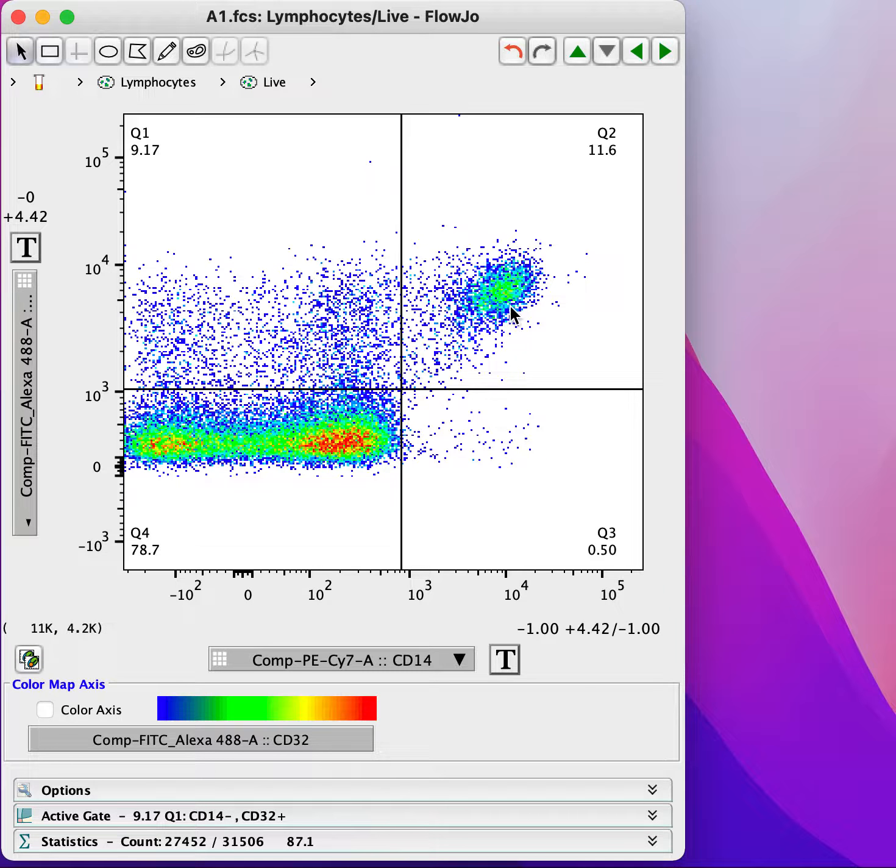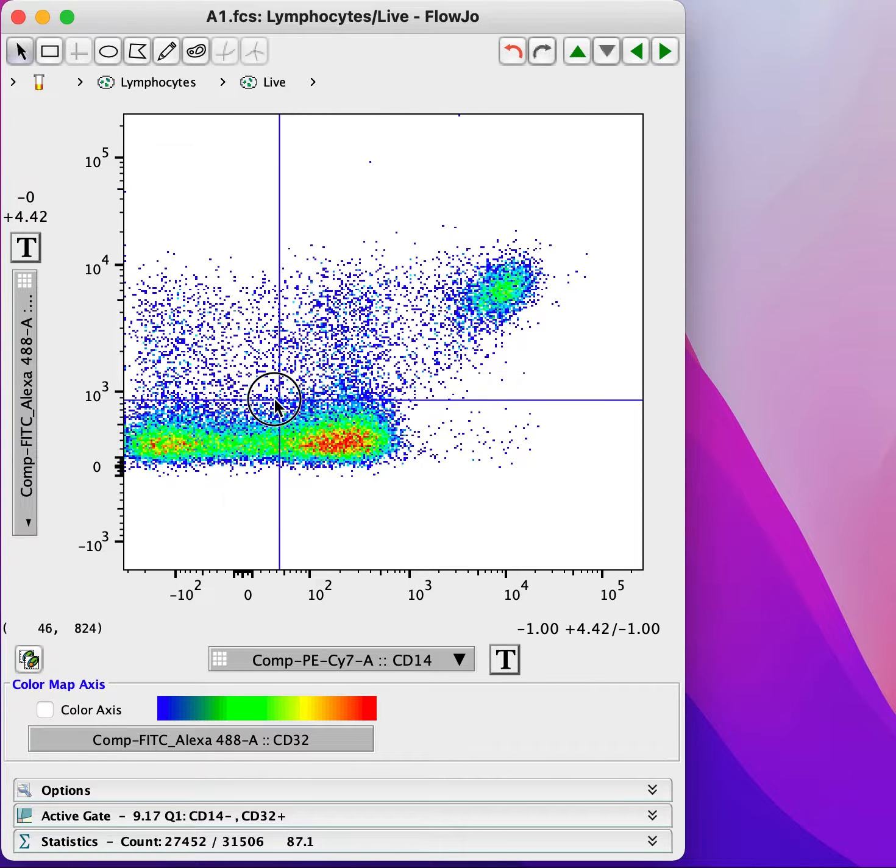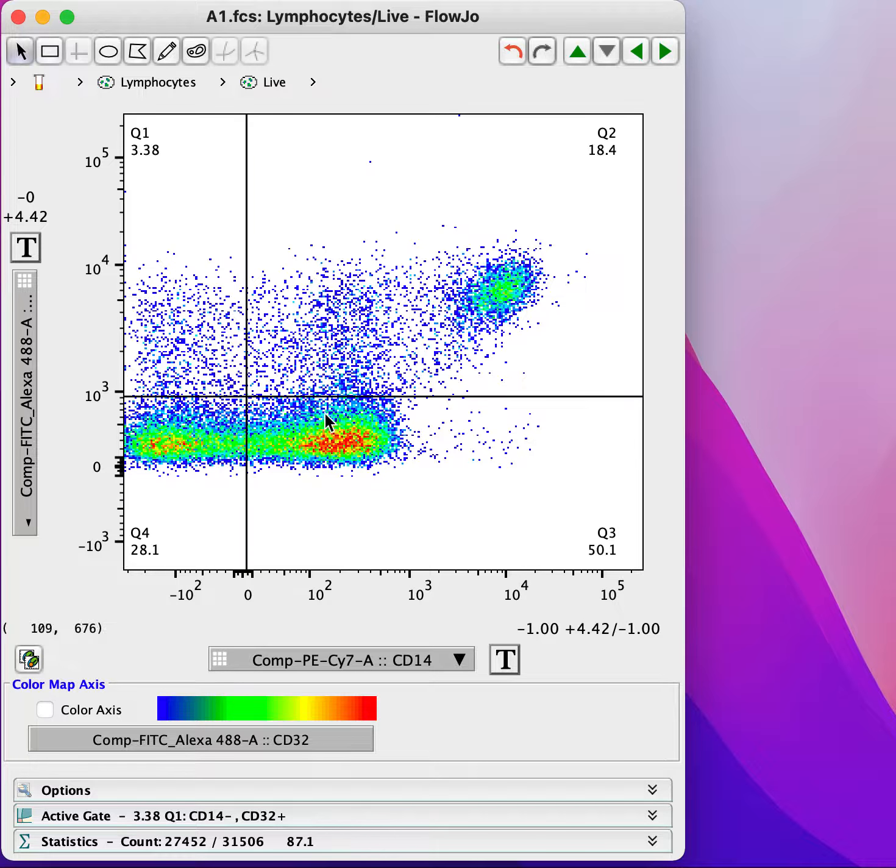And so we know that the positive is over here because we can see that clear population. But if that wasn't there, we might be tempted to interpret this data differently and say that this is our positive and this is our negative here, just based on the way the data look. But something that should give this away as being incorrect is that the division between these populations where we've put our gate is very close to 0.